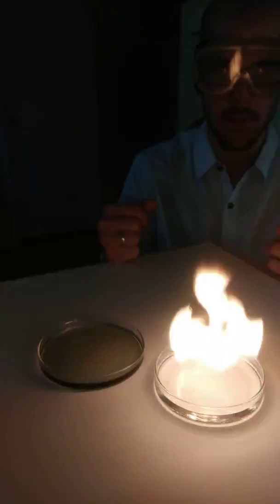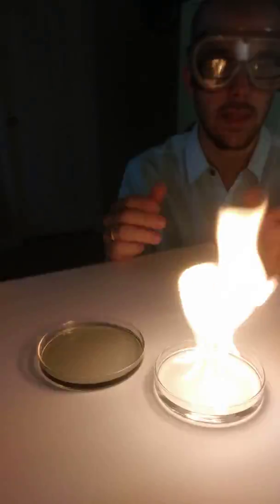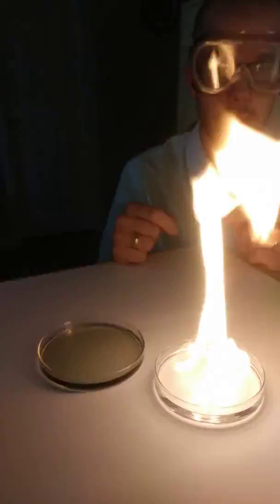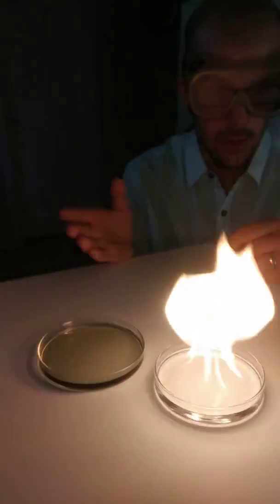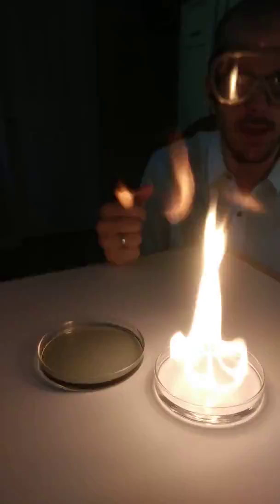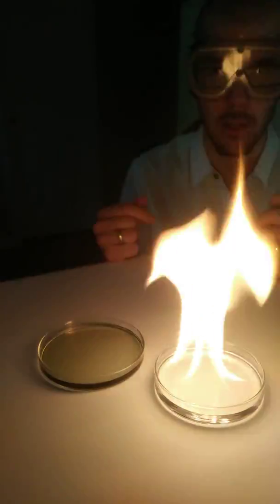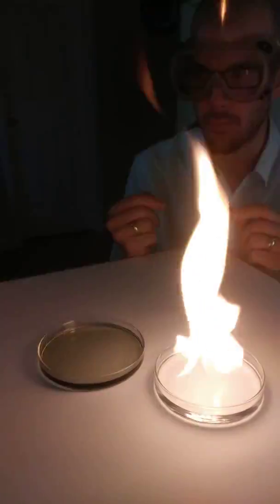This has burned for a few seconds. There's more than just heat and light — we notice that the flame is actually moving, so there's kinetic energy involved. One thing you might also notice is that the flame is kind of sitting on top of the ethanol as it burns; it's not like the whole ethanol goes up in flames all at once.